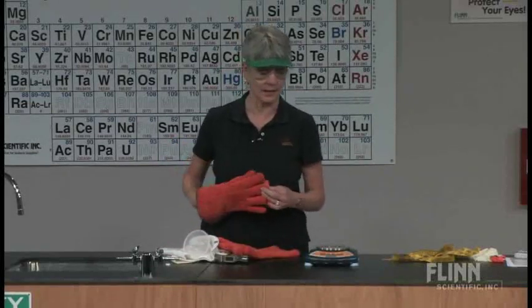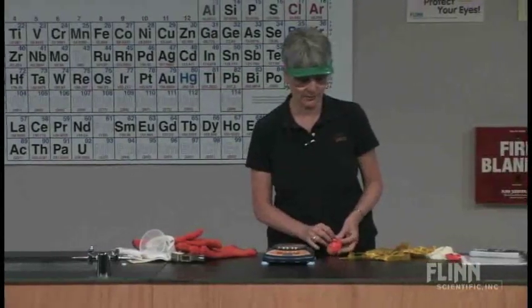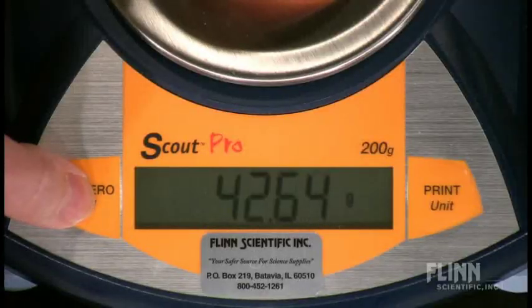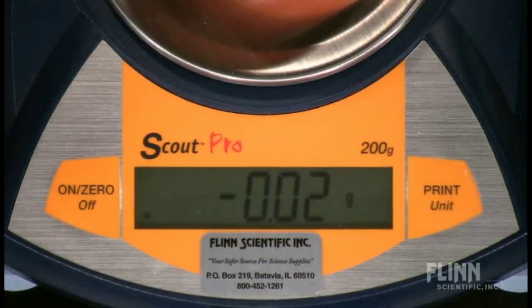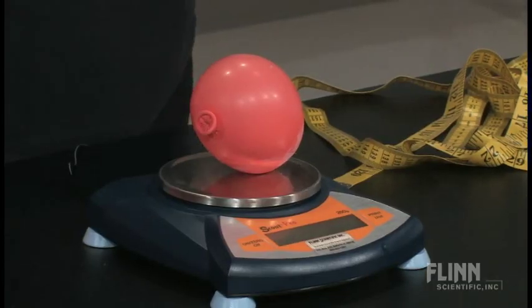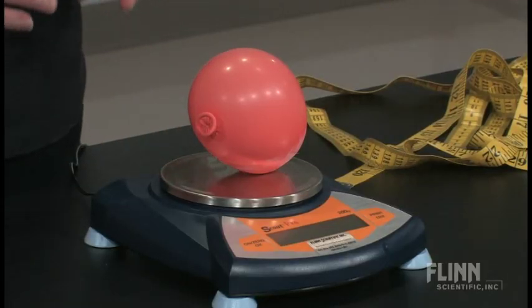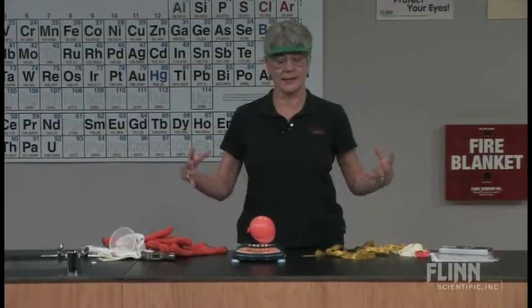I'm obviously not going to be able to tie the balloon wearing those gloves, so I'm going to put the balloon on the balance and tare it to zero as soon as I get it on. I'm going to tare the balloon to zero and observe what happens as the balloon inflates — I start getting negative readings on the balance. As that dry ice sublimes, the kids are thinking, 'Why is she getting negative readings?' Well, she just told us Archimedes' principle. The more air that's displaced, the greater the mass of that displaced air, and the buoyancy factor is caused by the force from the displaced air pushing back.